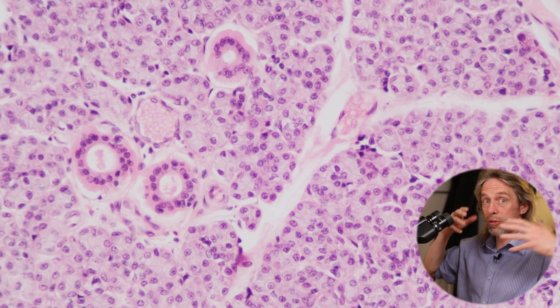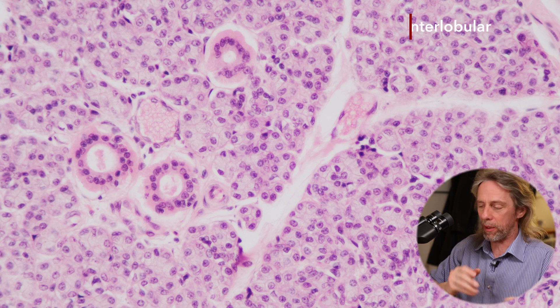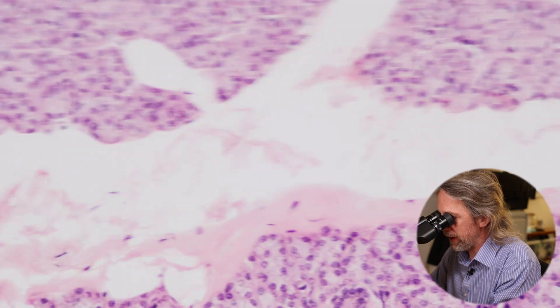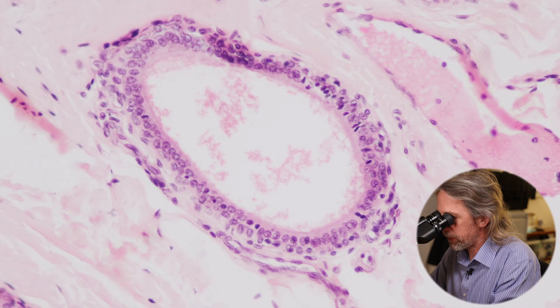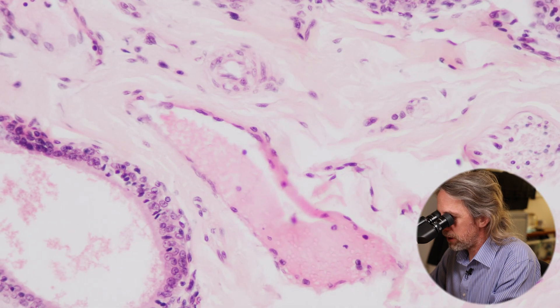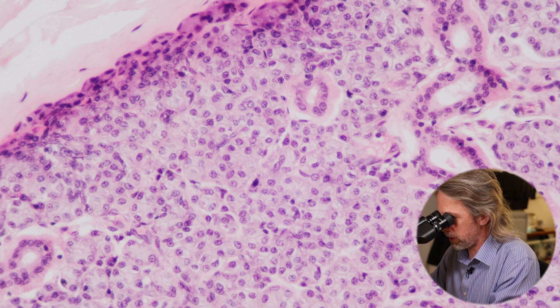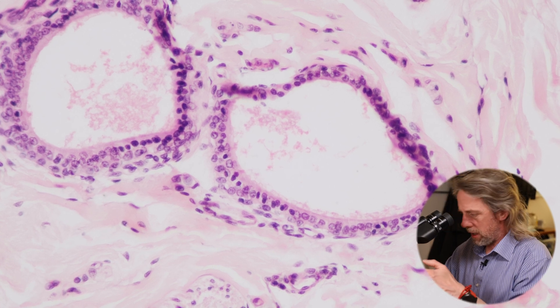Those ducts are going to take the saliva out of the lobule into the connective tissue between the lobules, so they become interlobular ducts — ducts between the lobules. This is another reason why salivary gland histology is classically taught: you get to use all these terms — intralobular, interlobular, and so on. In the connective tissue we're seeing some blood vessels and some interlobular ducts, which are bigger. Comparing intralobular to interlobular ducts: the interlobular ones are much bigger because lots of ducts have drained into this larger duct.